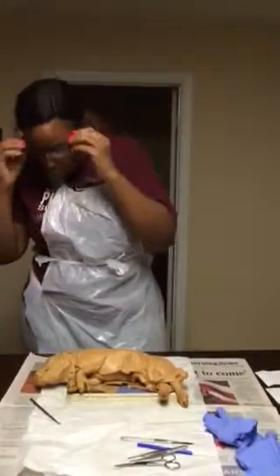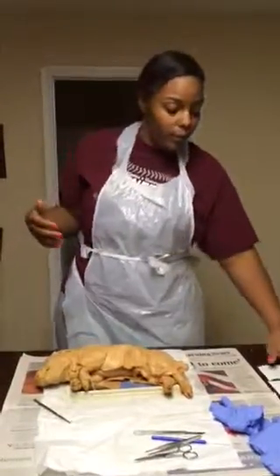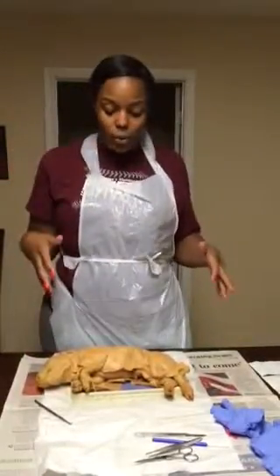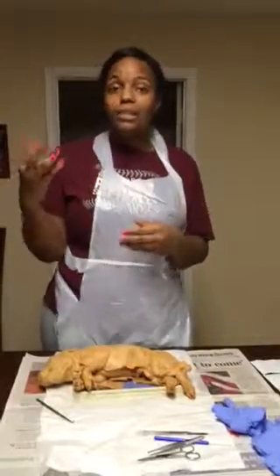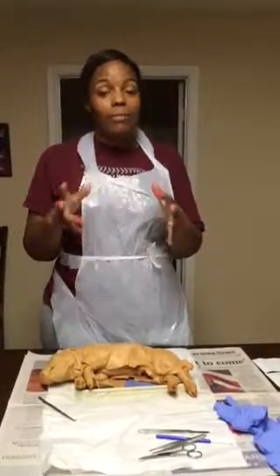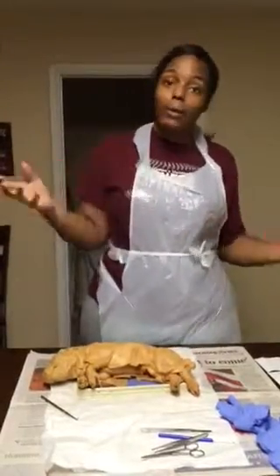Now I will answer the questions that were given at the end of the video. The first question was, do you notice a cover on the spinal cord, and what is it? There is a cover on the spinal cord, and it is called pia mater. This covers and coats the spinal cord with cerebral spinal fluid inside, and it keeps together the blood vessels and the nerves, and it protects it. So that is what is along the spinal cord.